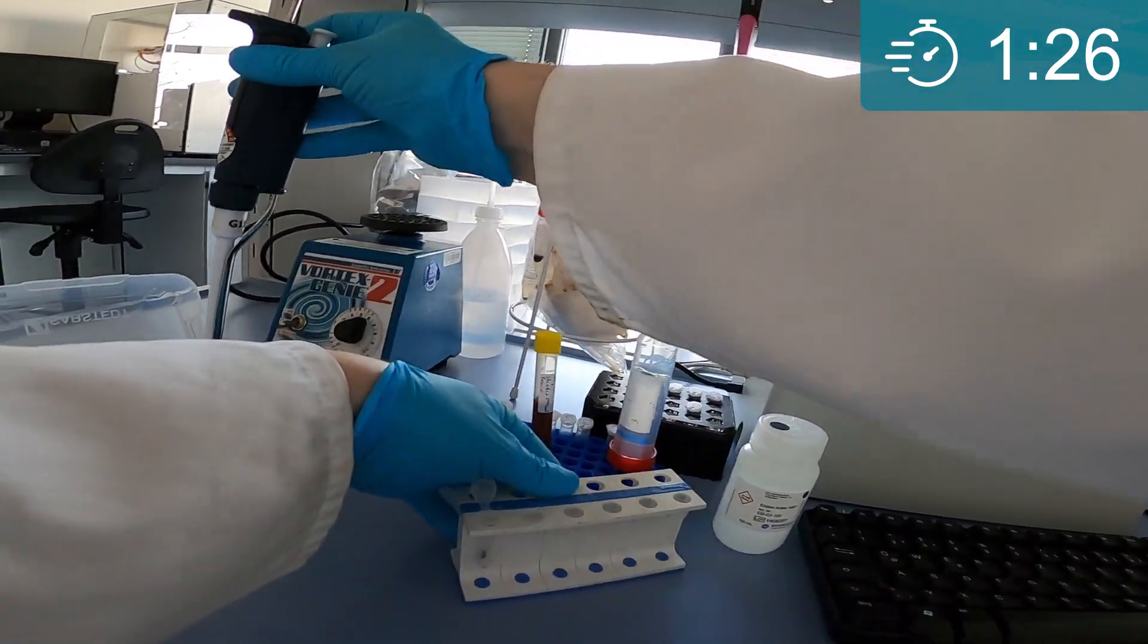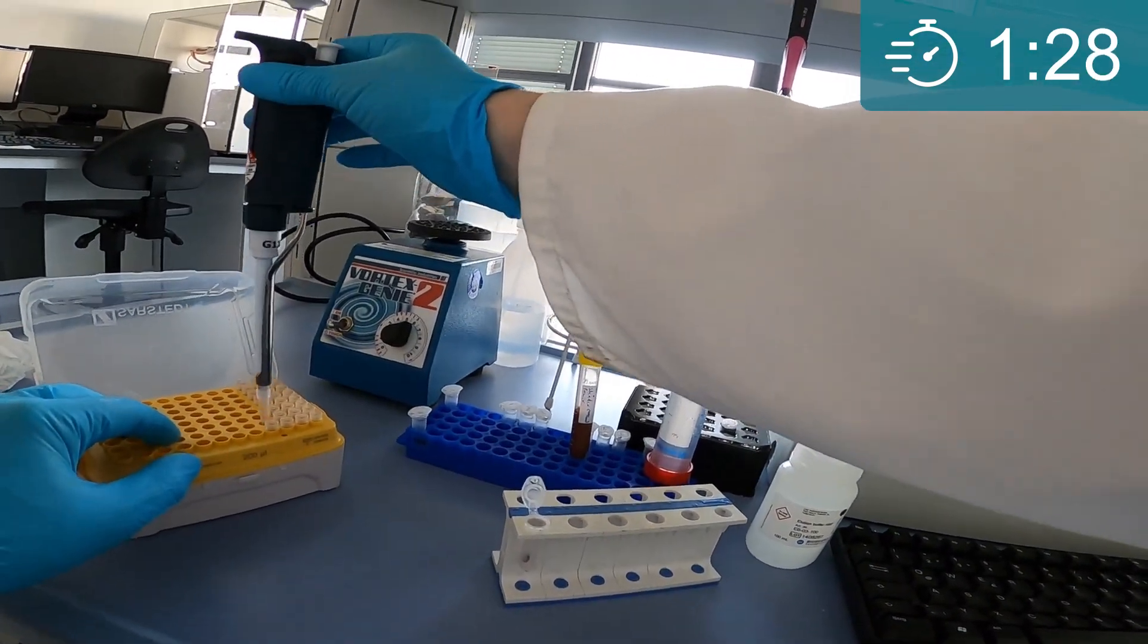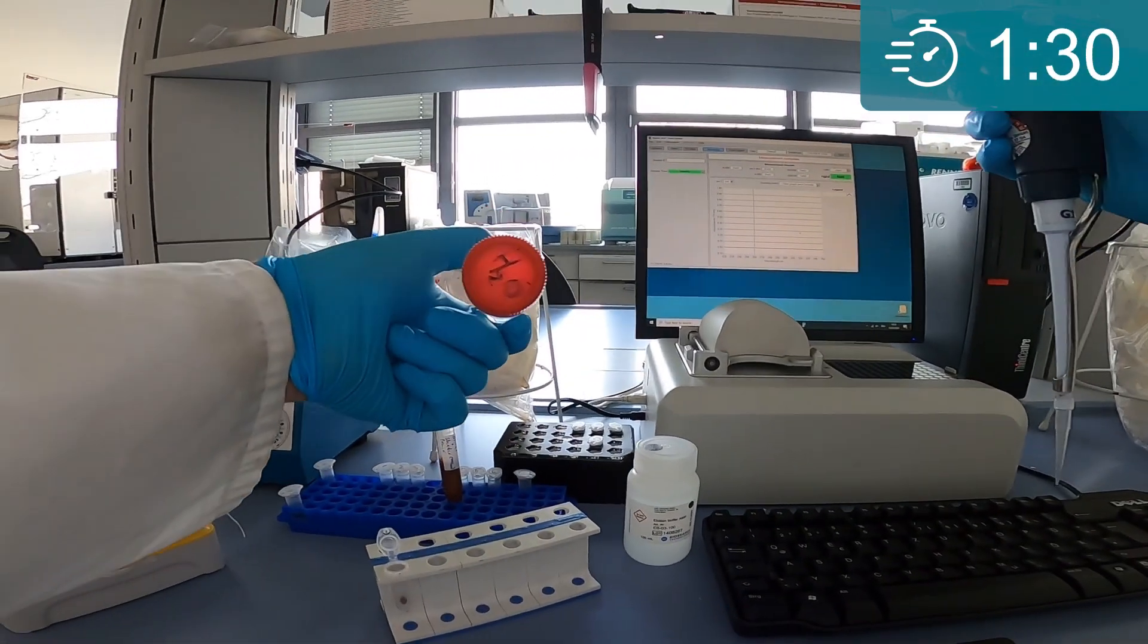You then simply add two volumes of ultra-pure or desalted water on top of the beads.